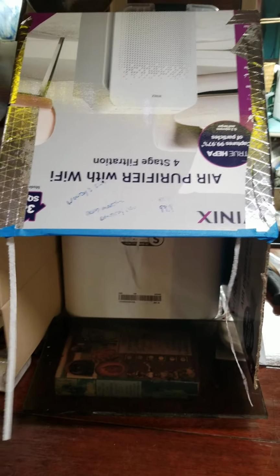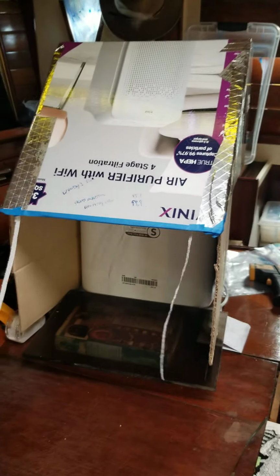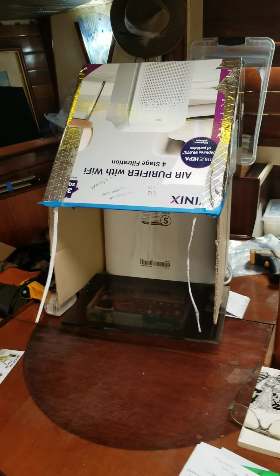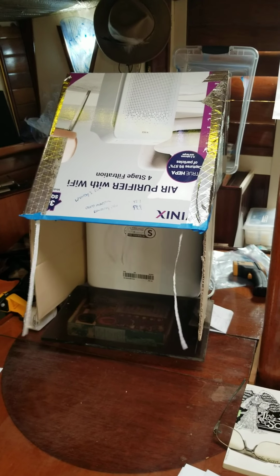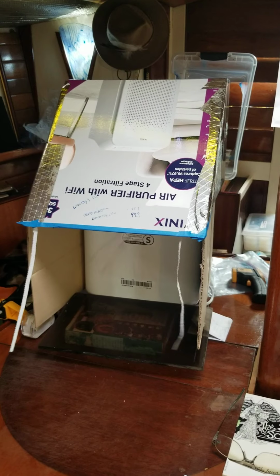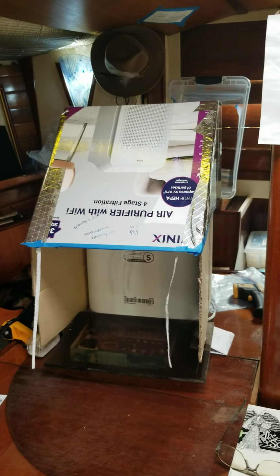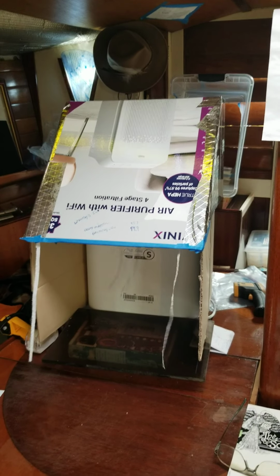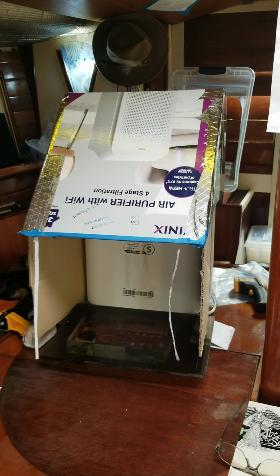And the reason I'm posting this is because on the websites people will tell you you need at least 500 cubic feet per minute, and you have to figure for this high airflow and get the smallest HEPA filter is 1 foot by 2 foot, and they cost $150, and then you need to buy a fan, and that's $150, and then you have to wire it all up and build a box for it, and you're looking at $300 or $400 for this high flow thing.